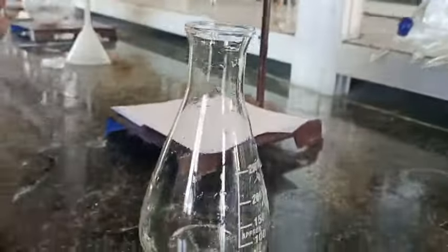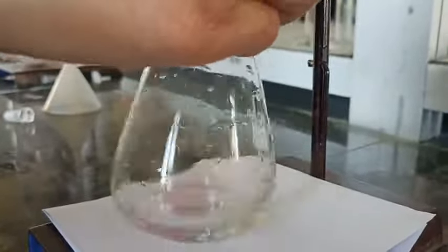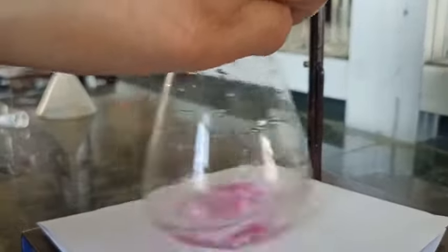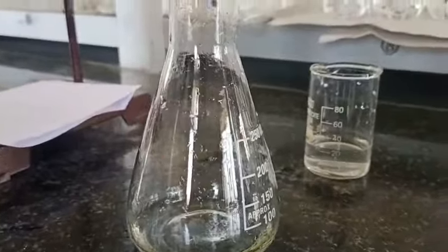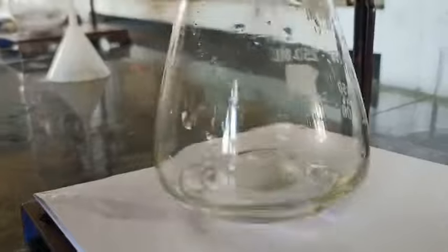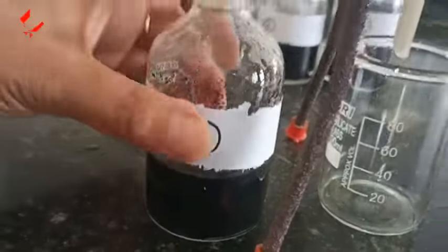Now I am going to titrate bottle number 3 solution. I have taken 10 ml, added one drop of phenolphthalein — here is the initial reading. At the end point we see the pink color of phenolphthalein, which shows pink color in basic medium. Similarly we do the same with the 4th and 5th solutions — this is all done before adsorption, on the solution still left in the measuring flask. For the 5th solution of 0.1 normal acetic acid, here is the end point and here is the final reading.